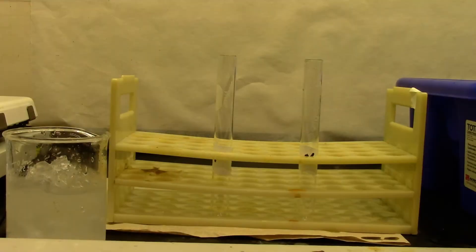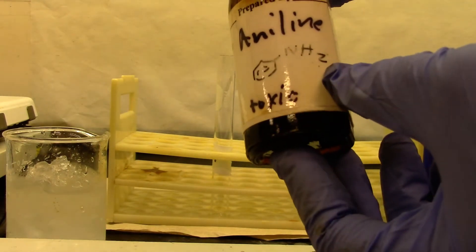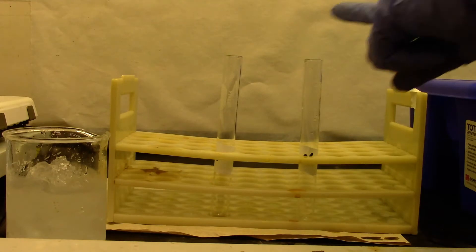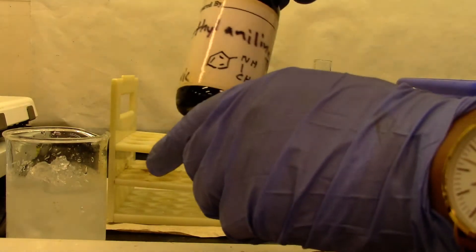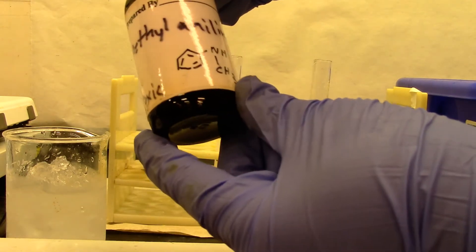We will be doing nitrous acid test for amine. I am going to use two different samples. One is aniline, which is aromatic and also a primary amine. This is my second sample, which is a secondary amine, N-methyl aniline.